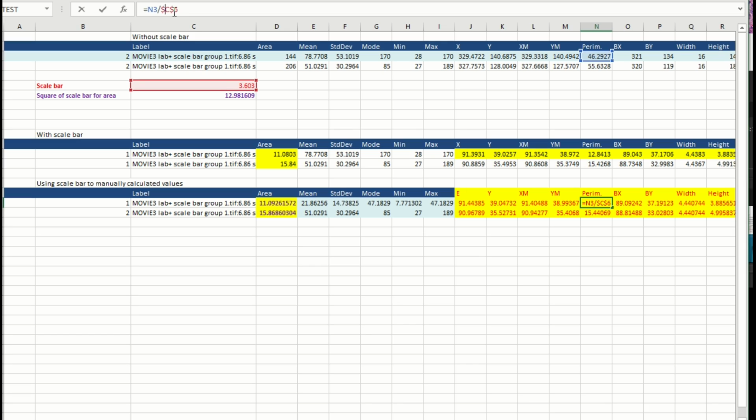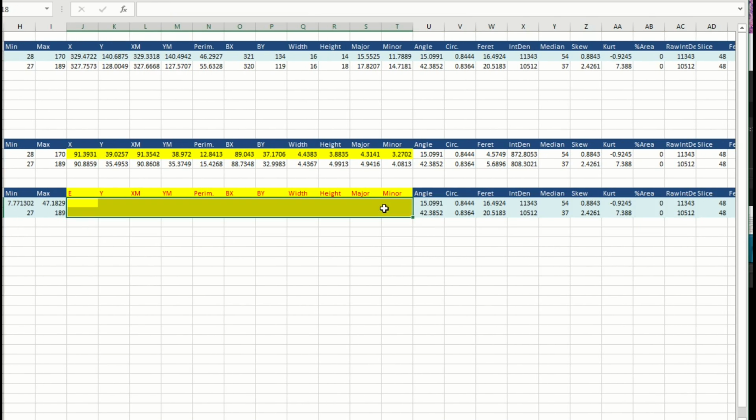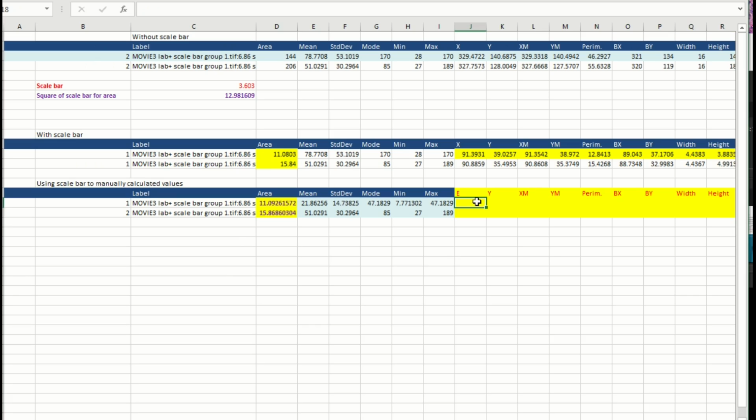So you take 46 divided by the scale bar. Remember, if you know Excel, just add this dollar symbol and the cell is not going to move. If you want to know how I would do this very fast, imagine that I delete all this information and I get it again, easy. Go here. I add equal J3, the beginning, divided by my scale bar, and add the dollar symbol.